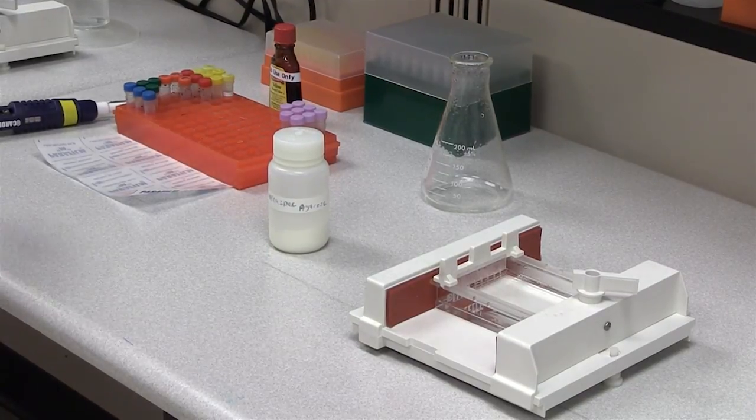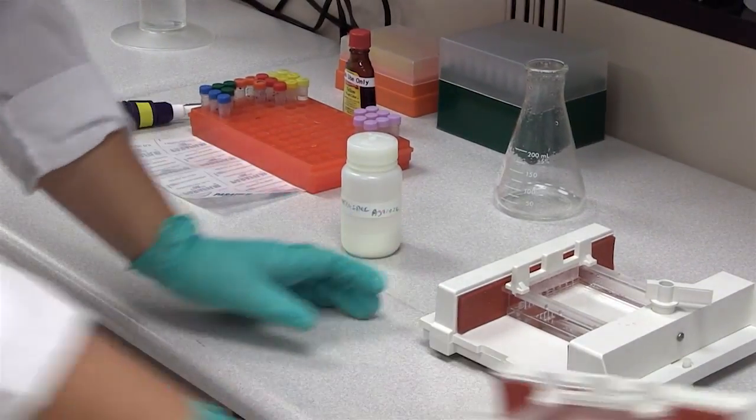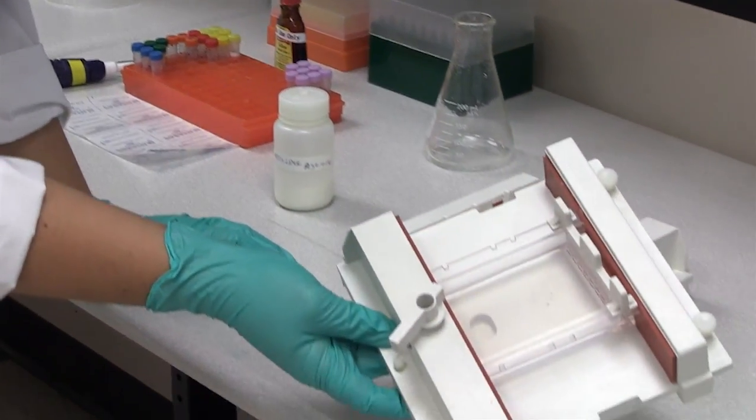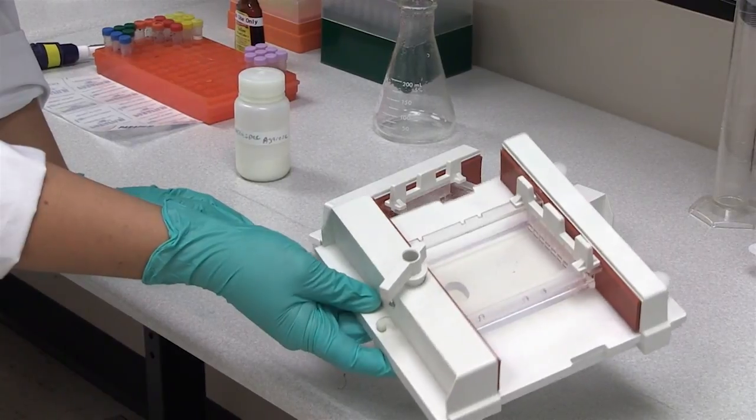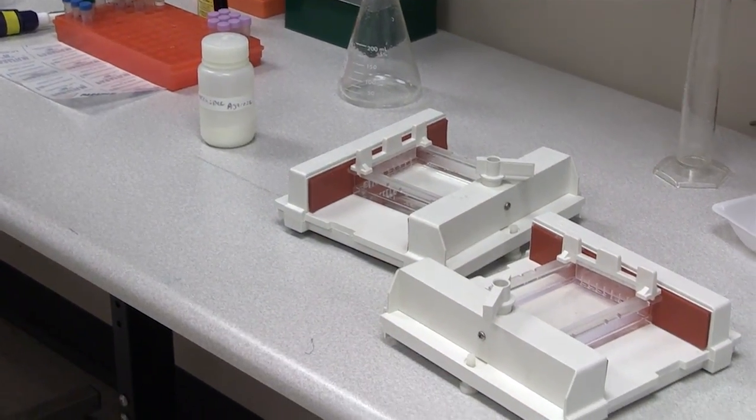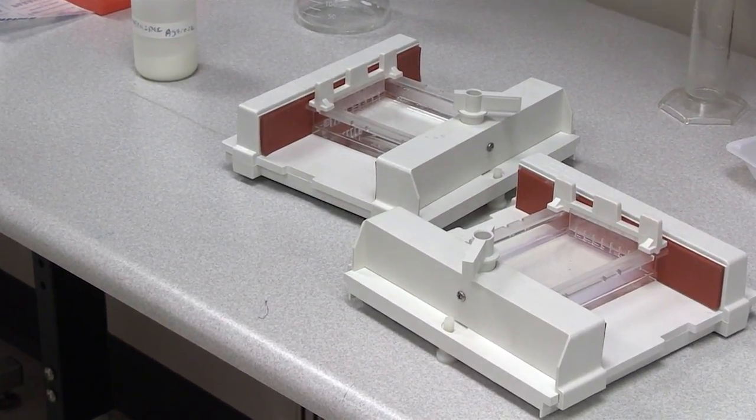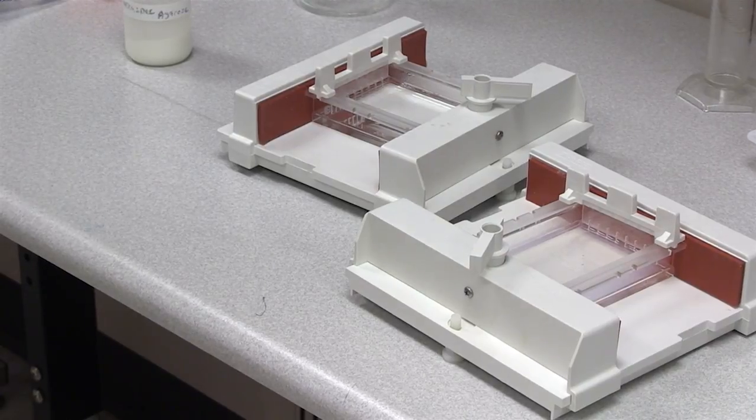Just like a cooking show, we already have one that is done. So you can see this gel is opaque in nature. It is firm and it is ready for us to use so that we can load it into our electrophoresis and add the buffer and start adding the dyes that we are going to run today.